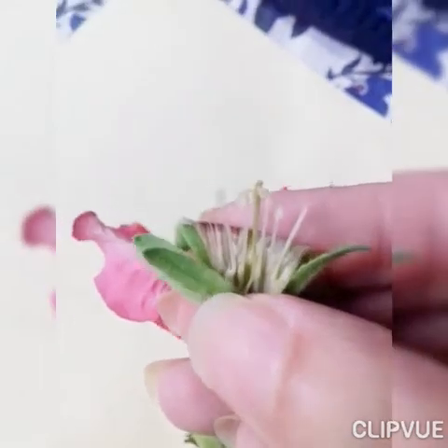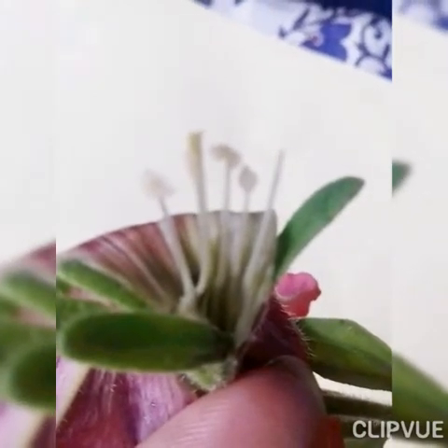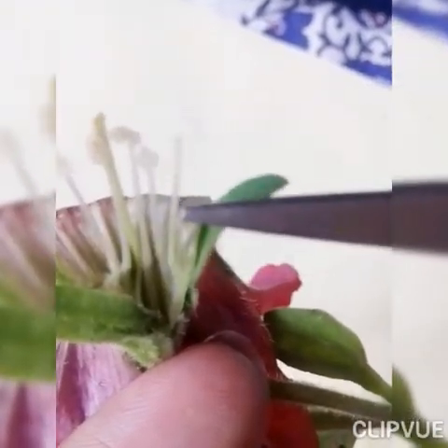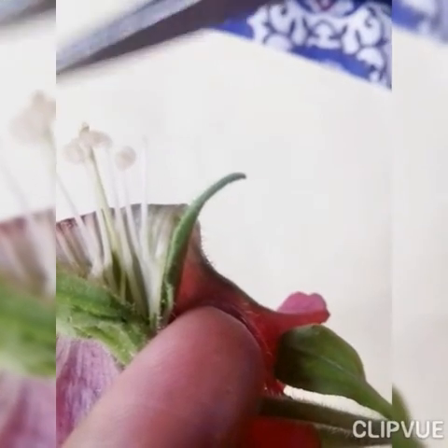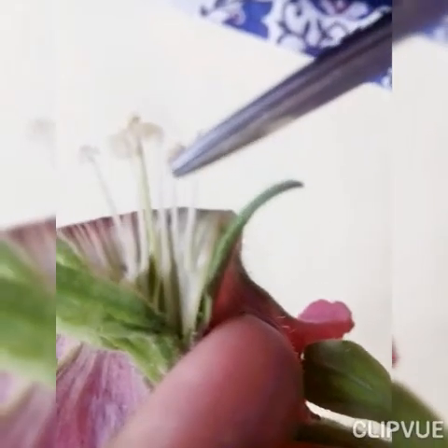Now I'm trying to zoom in to show you the stamens properly. These are the stamens, and this part is called the anther. The slender stalk is called the filament. So this is the filament of the stamen, and these are the anthers which contain pollen grains. The stamen consists of two parts: the anther and the filament.